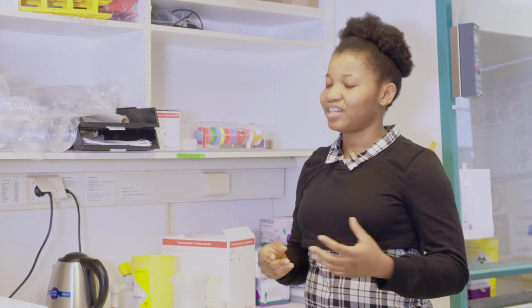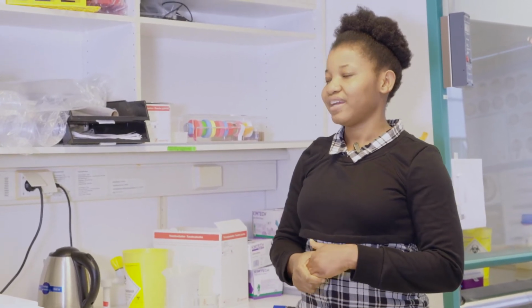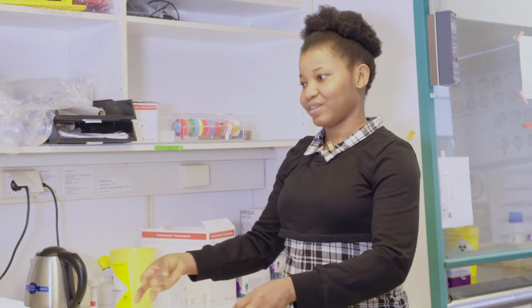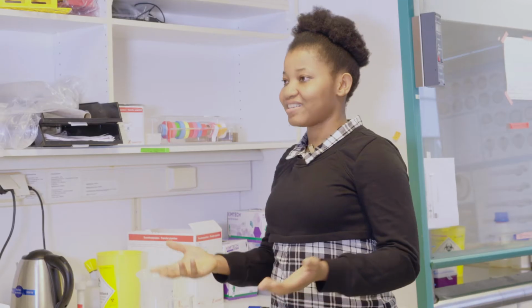So if you find a gene that you are interested in, you can easily edit the gene, for instance, and then work with them. Another advantage, considering that we are a chemical neurobiology lab, is that they absorb substances like drugs through the water. You just dissolve the compound in the water, and the fish absorbs the active compound, and you can easily read out the effects. One of the last points I would like to mention is that fertilization occurs ex utero, and development also occurs ex utero.